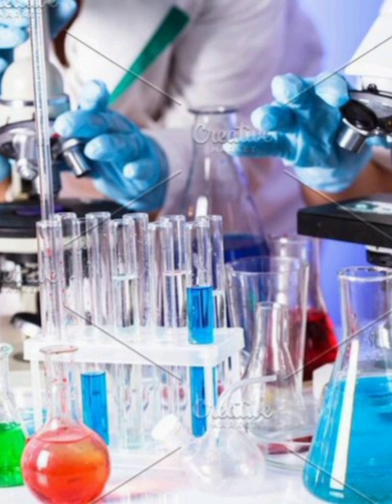Laboratory glassware is made from borosilicate glass, which is resistant to thermal shock and chemical attack. Volumetric glassware must be washed and dried before use, as unclean glassware can introduce contamination errors. So, let's have a look at them.